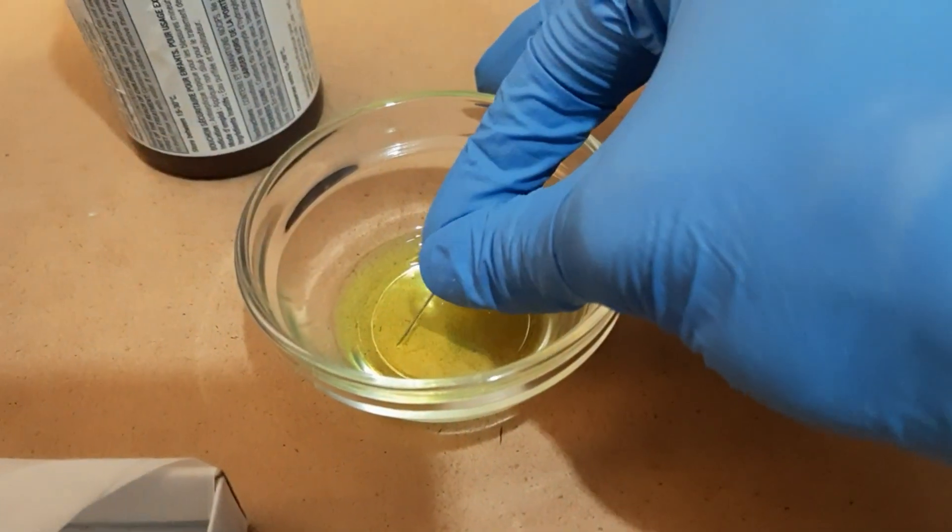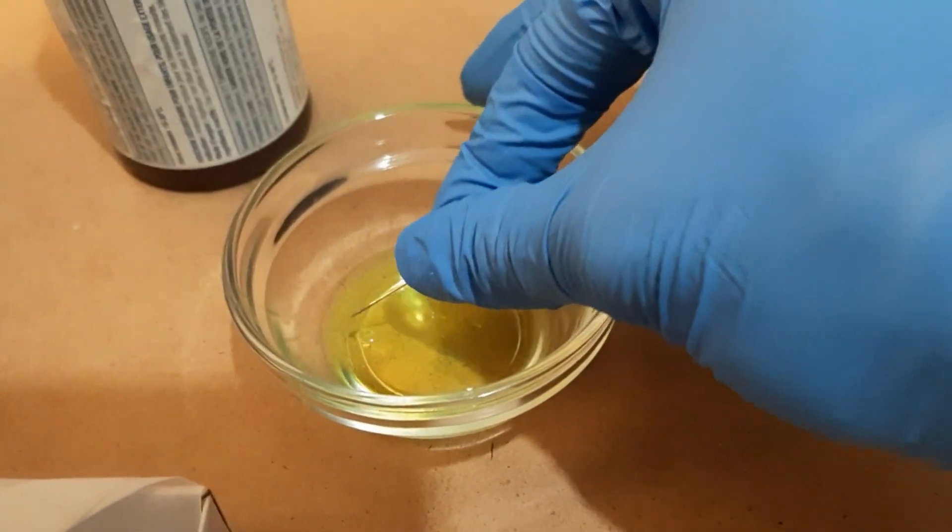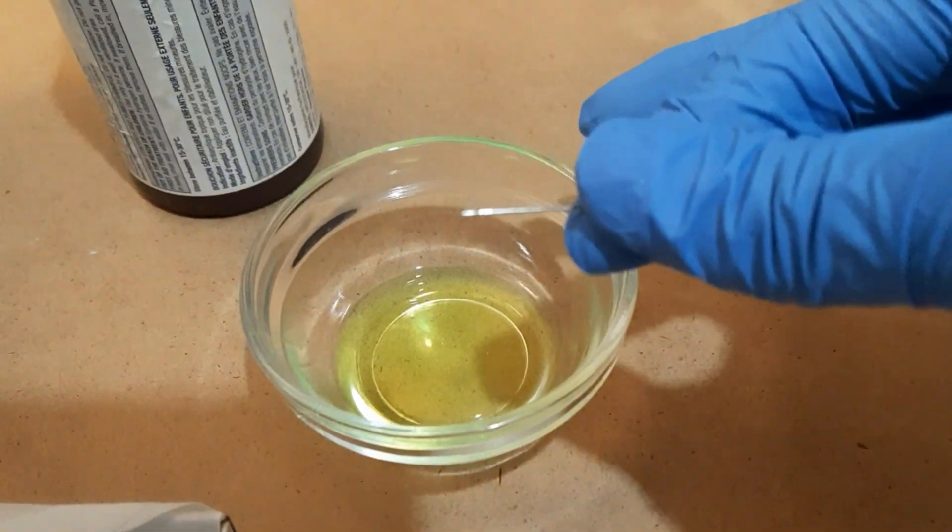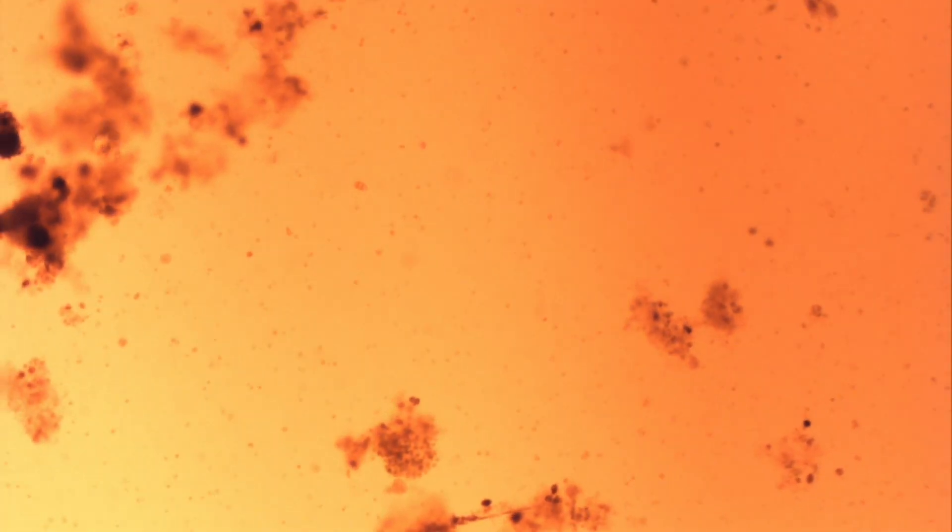I tried the pin method with the soap next. It was actually a lot more effective than I thought it would be. Likely because it's not as volatile, so a lot more of it was actually transferred into the water compared to the sanitizer.